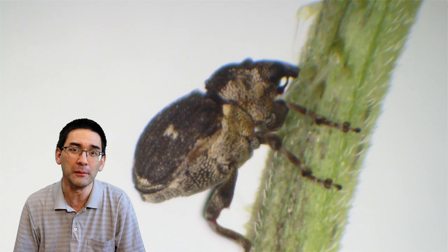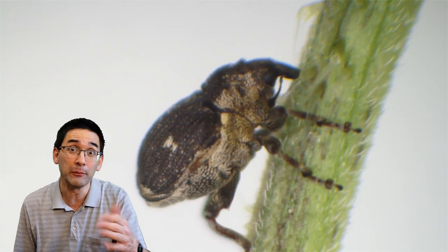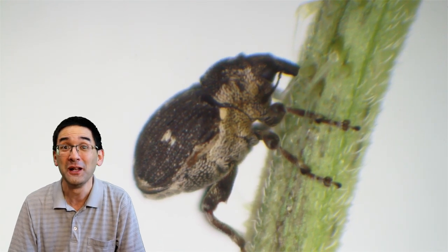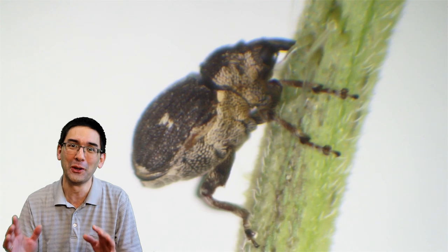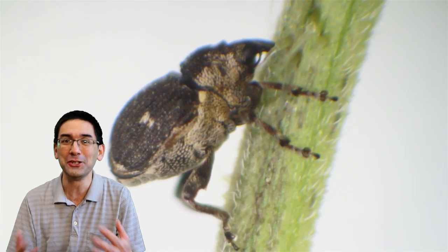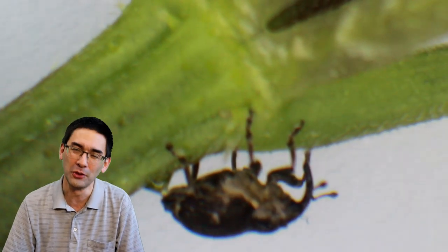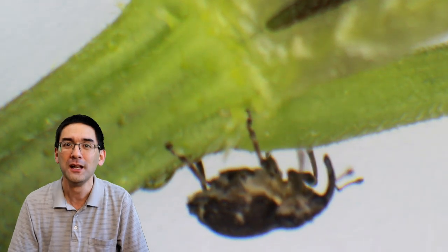There are a couple of tricks and tips that can make life a little bit easier, because one of the things you don't want is to miss out on those very rare and interesting occasions — for example, when an insect poops right in front of you and you don't have it in focus, like in this case.